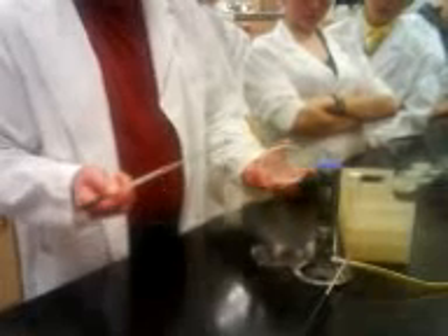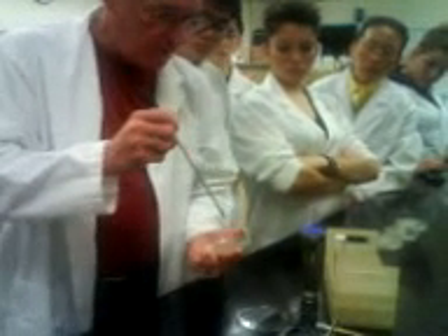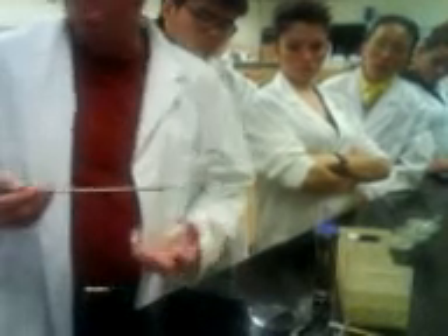Then we'll take the plate like this and work close to the flame. I'm going to go real slow here — I'm going to compromise the sterility and the aseptic techniques we're using. I've got the needle coming in at a shallow angle. We're not trying to streak it like this, breaking the surface of the media — you don't want to do that. I'm exaggerating.